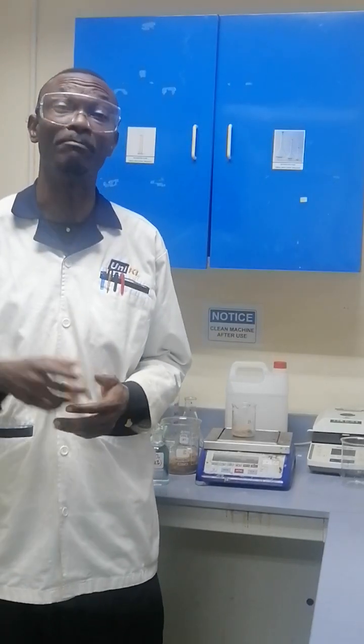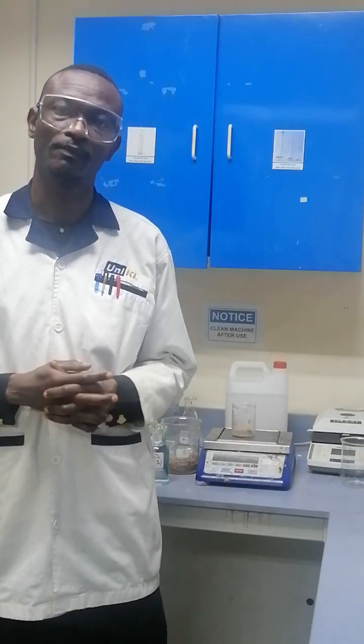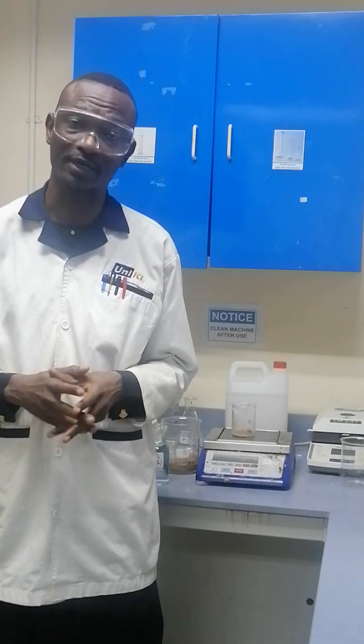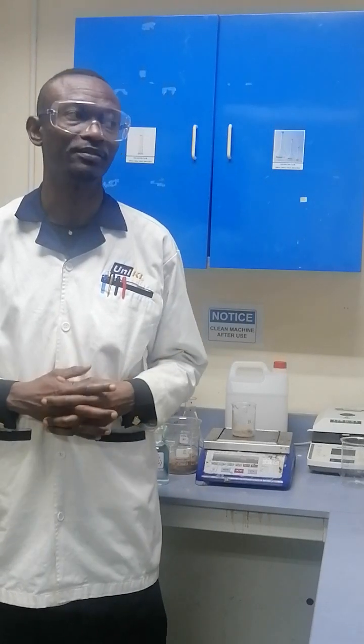Welcome to this episode of Laboratory Methods and Safety Tips. What is the most abundant waste on the surface of the earth? Plant biomass, also known as lignocellulosic biomass, is the most abundant natural waste resource on the surface of the earth. An estimated 181.5 billion tons is generated per year, out of which only 8.2 billion tons is utilized.